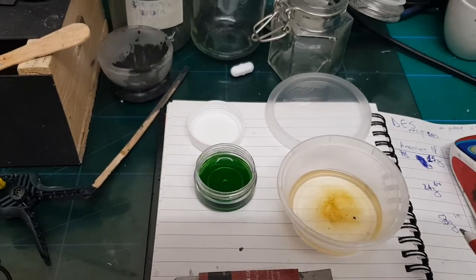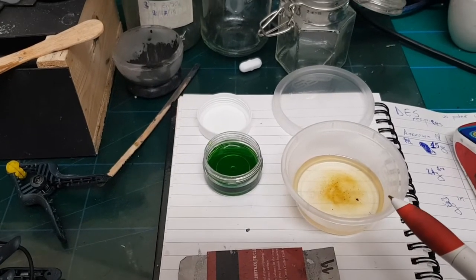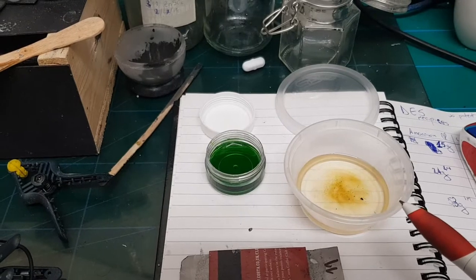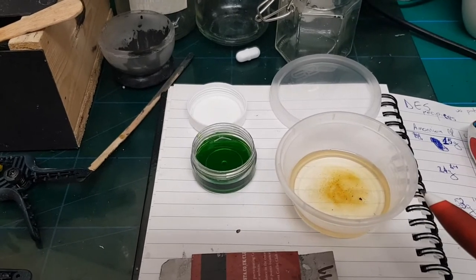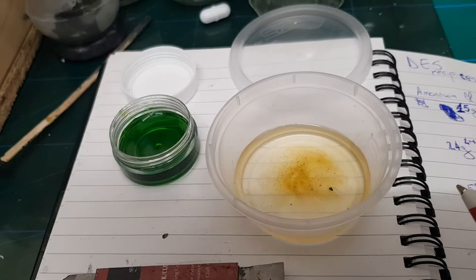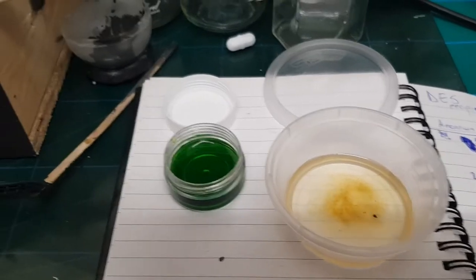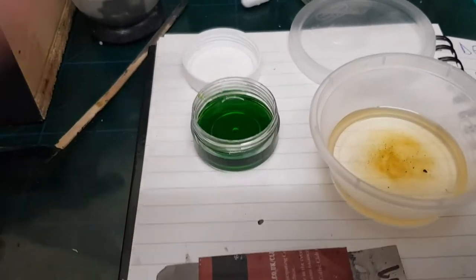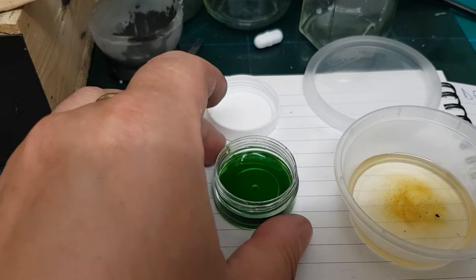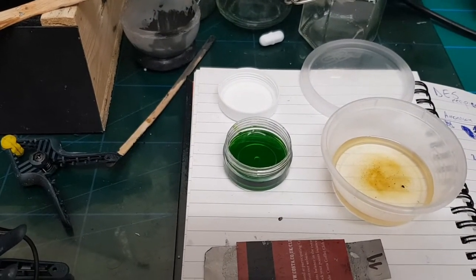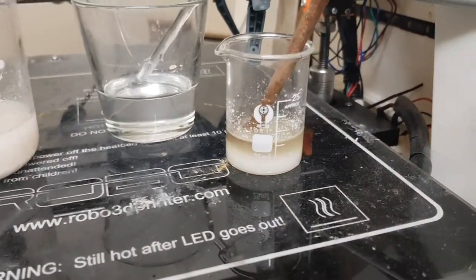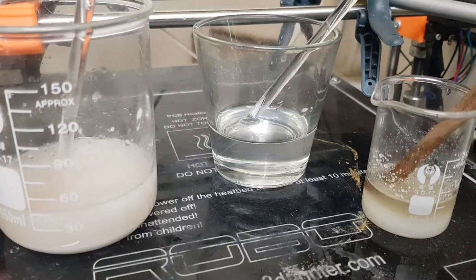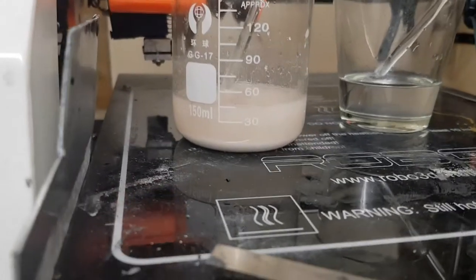In front we have my first deep eutectic solvent made about four to six months ago. It was transparent yellowish and now has some sediments. This one is a lovely emerald color based on nickel chloride and urea. I'm also preparing zinc chloride and urea, and ammonium chloride and urea.